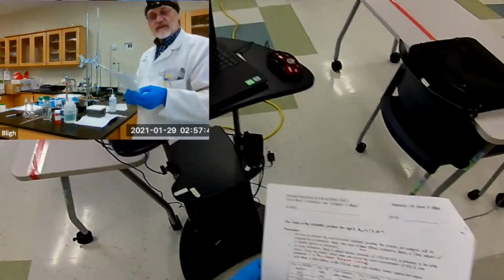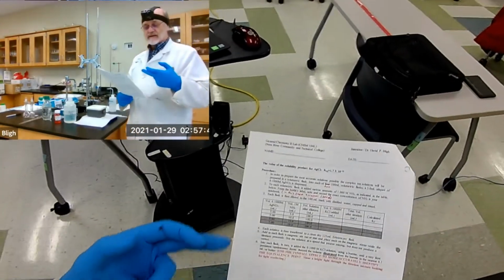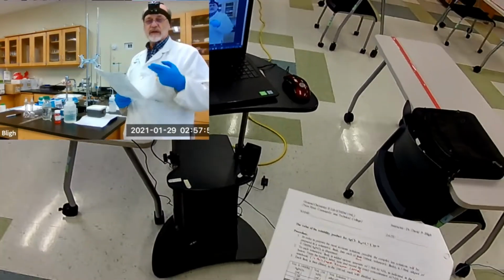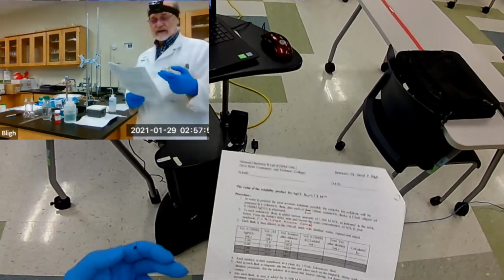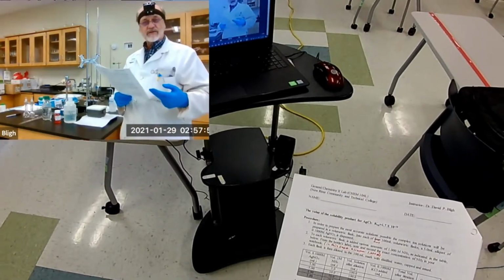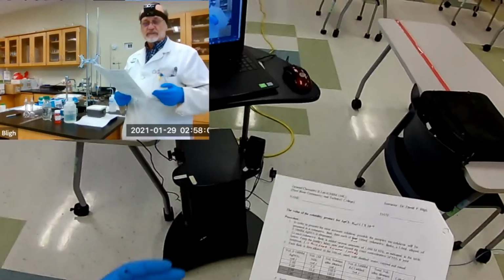But what I discovered the hard way, and my class with me, is that the higher concentrations of ammonia are extremely difficult to get accurate results. And the only reliable results that we've been able to manage so far are with the very lowest concentration of ammonia.